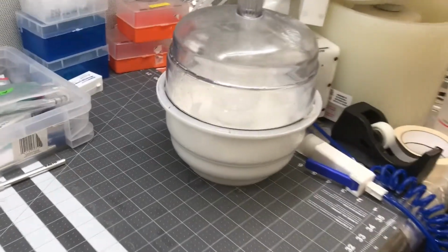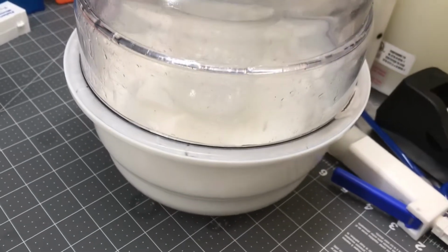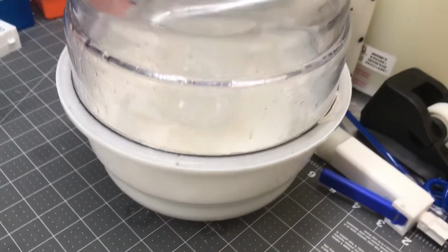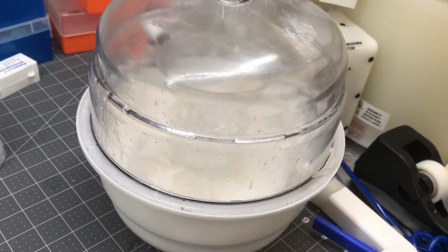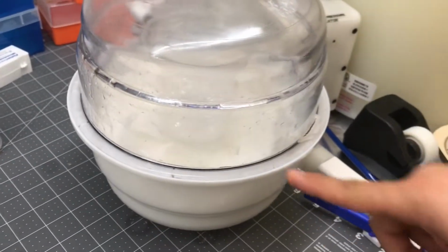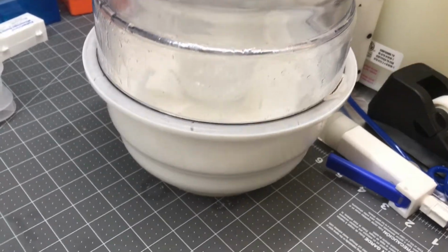So this shows two layers. Zoom out. You can see here as well.